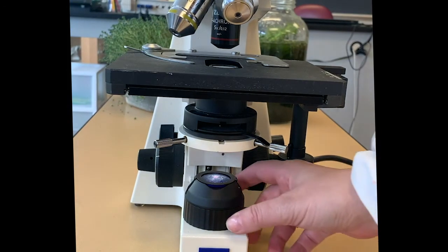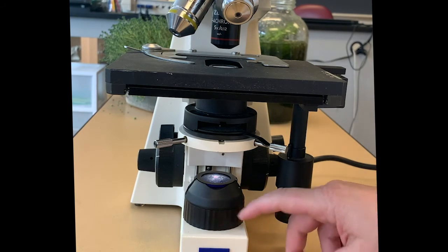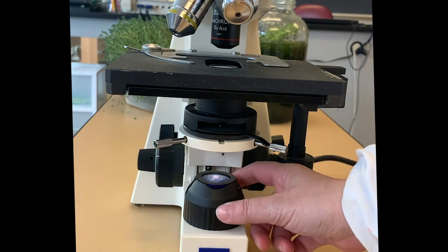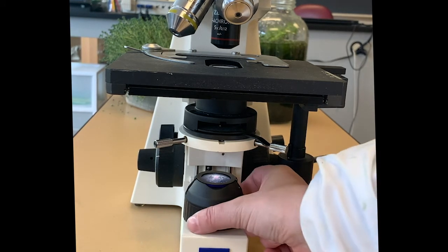We're just going to look at a few additional parts here. We have the field diaphragm down here. This is the place that we have the light bulb. There's a little diaphragm above the light bulb that lets more or less light out. So there's an adjustment for that at the bottom here.